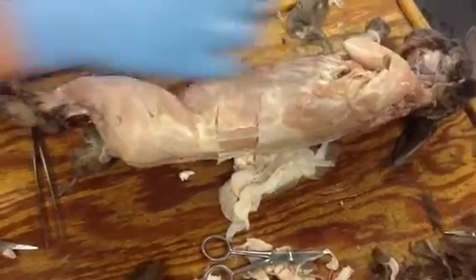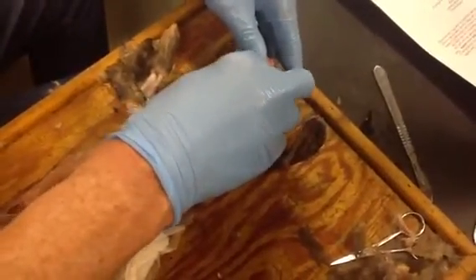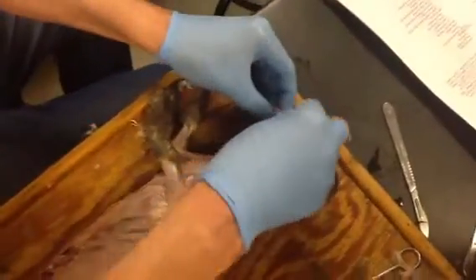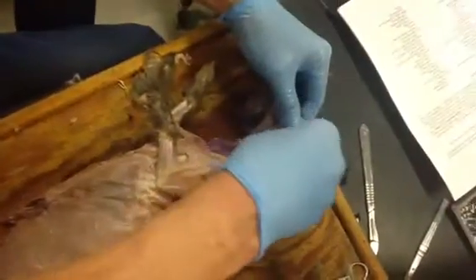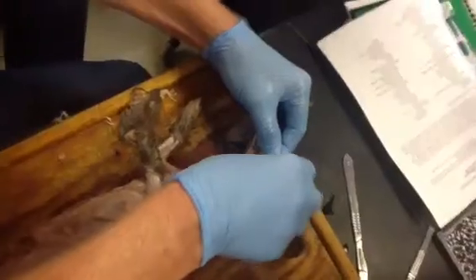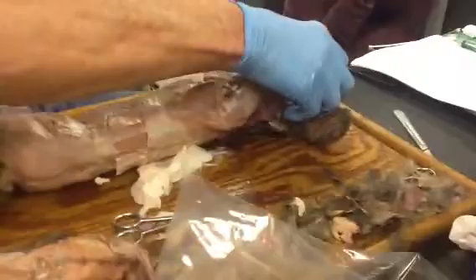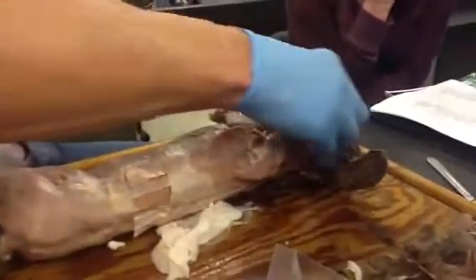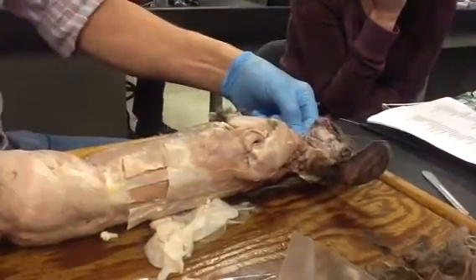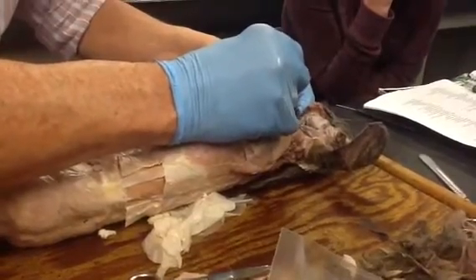I can only find geniohyoids up in here. You're going to have to finish skinning the chin and then look right up in here for genioglossus and geniohyoid. Think about them from the necturus — that tiny little triangular one underneath there. It was necturus because we didn't see them in the frog. And then in the shark, the coracomandibular muscle is up in here.